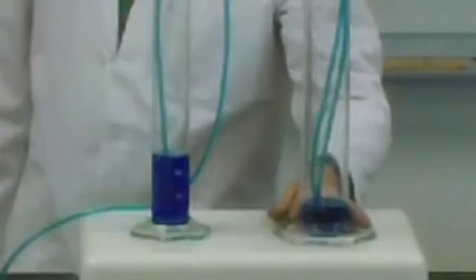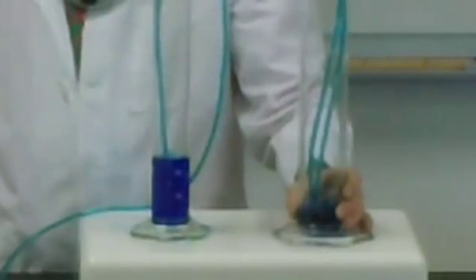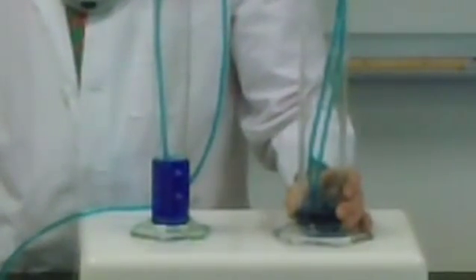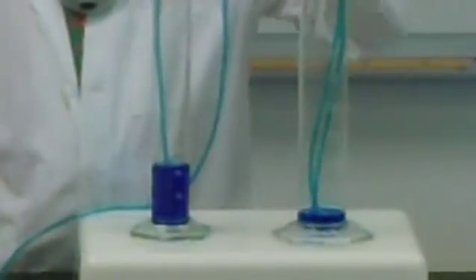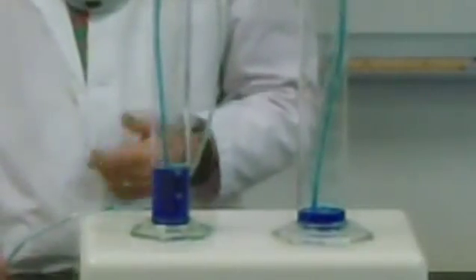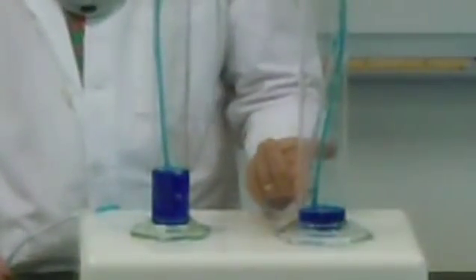See like this. I'm letting the product be somehow removed. So it doesn't reach equilibrium. Although eventually what's going to happen here is once I lose my siphon, now it's going to start building up because I just lost the siphon.